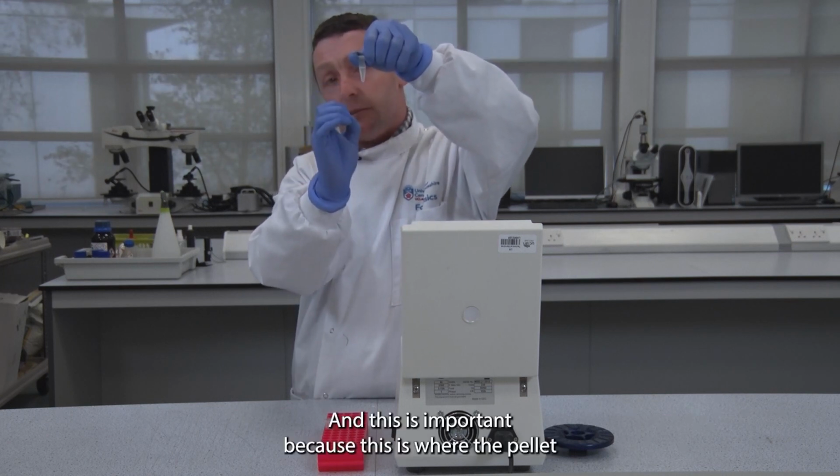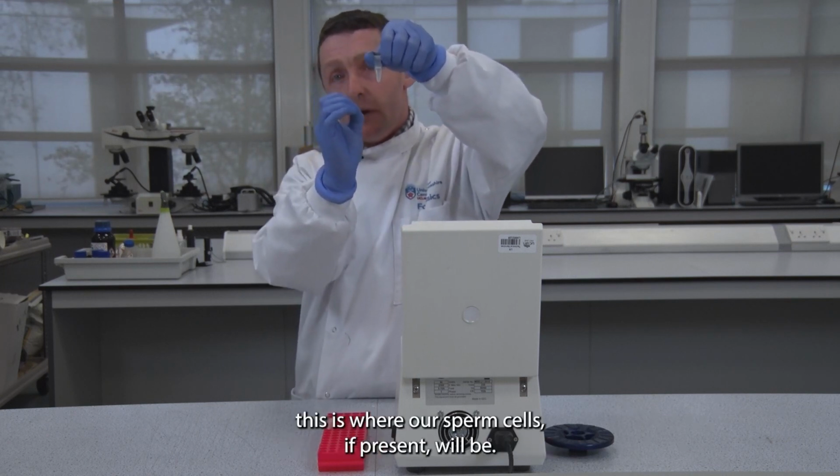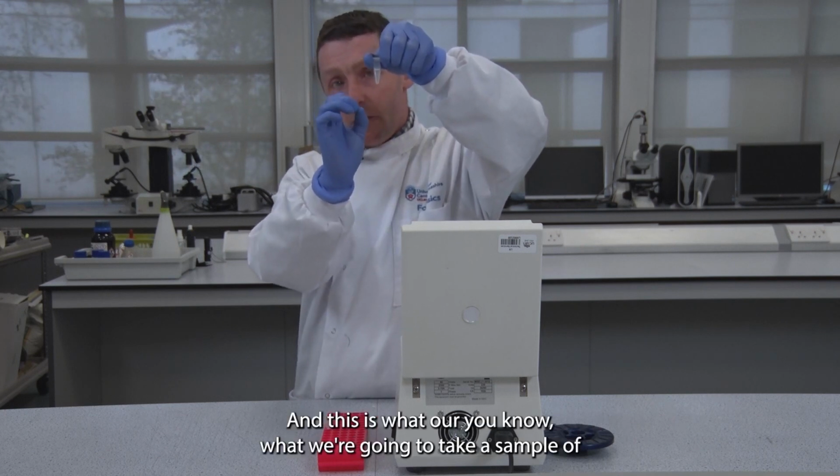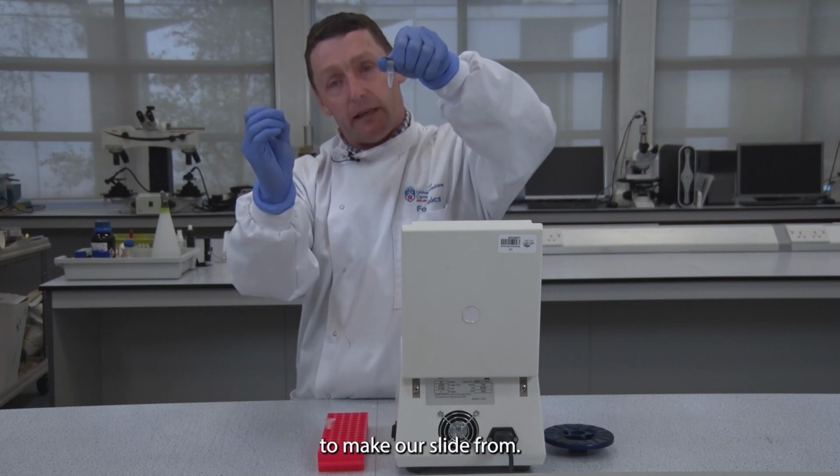And this is important because this is where our sperm cells, if present, will be. And this is what we're going to take a sample from to make our slide.